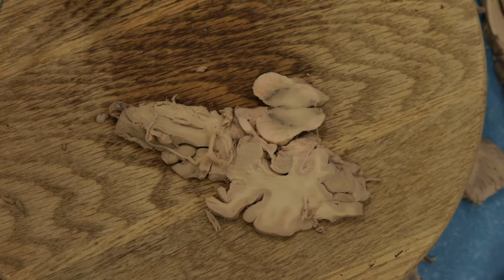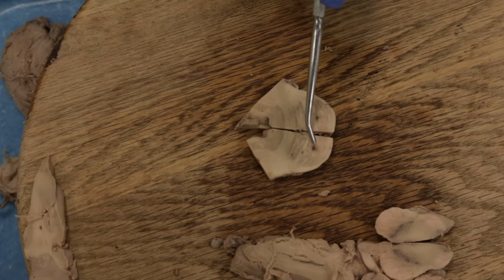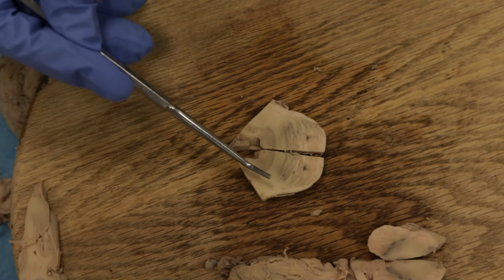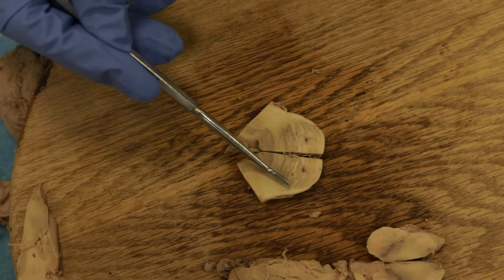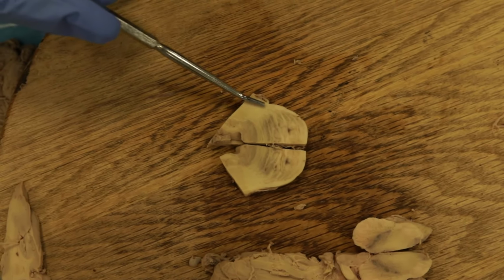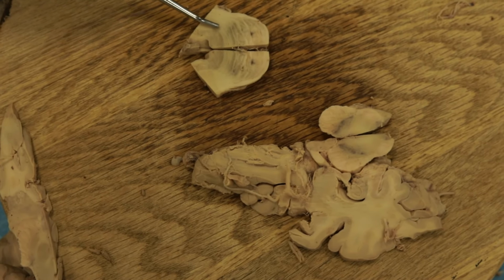All right, now let me just show one last thing here. I made one more cut into the pons. We're still seeing some of the locus ceruleus here. But just appreciate these horizontal fibers in the pons, and they're moving out into this myelinated pathway here. This is the middle cerebellar peduncle. So the pons is continually sending information to the cerebellum through the middle cerebellar peduncle. I think we'll stop there with our horizontal sections, and we'll move on to some coronal cuts.